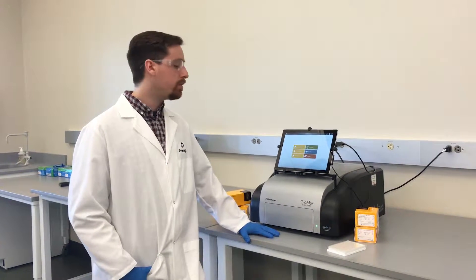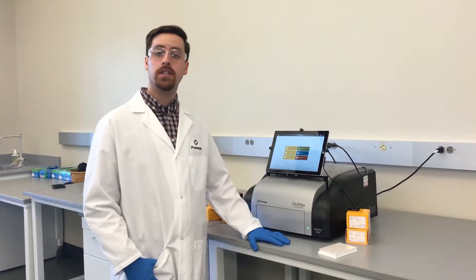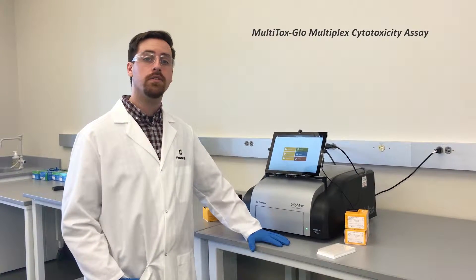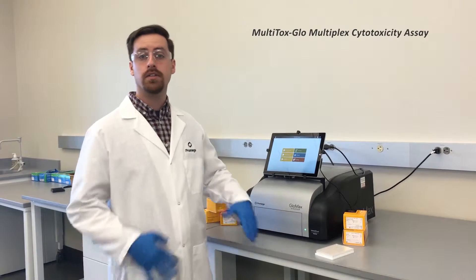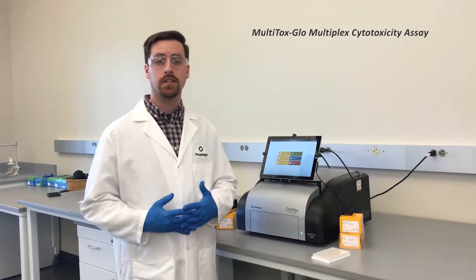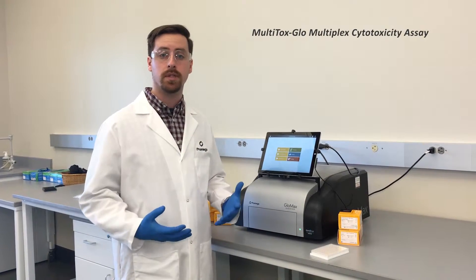Hey, I'm Mark. Today we're going to use the Glomax Discover to measure signal generated from the MultiTox-Glo Multiplex Cytotoxicity Assay. This assay gives ratiometric, inversely correlated data on cell viability and cytotoxicity. The ratio of viable cells to dead cells is independent of cell number and can be used to help normalize data.